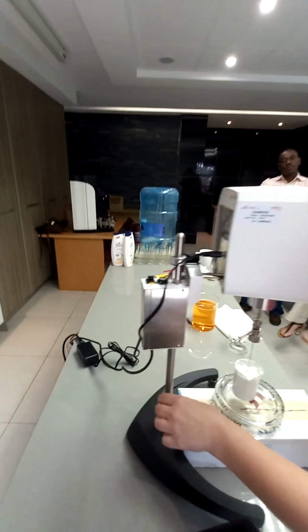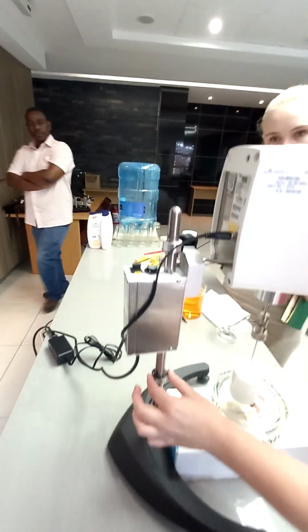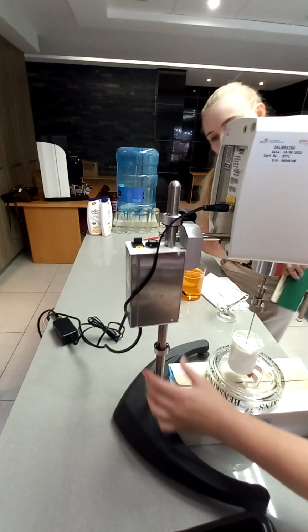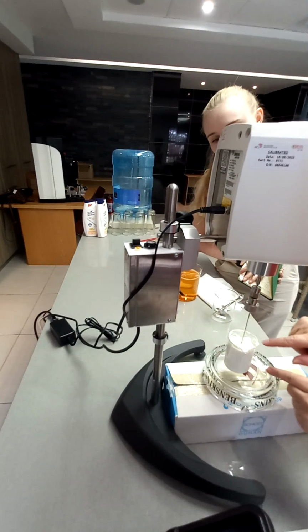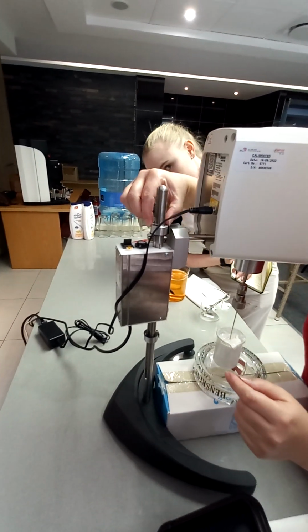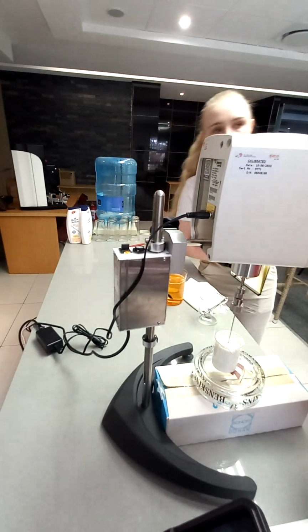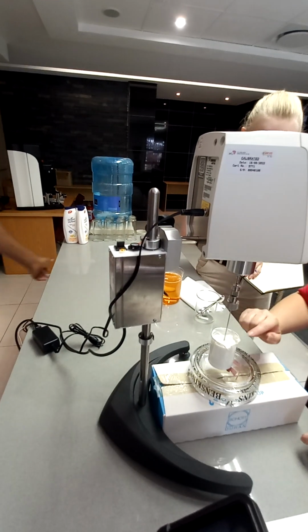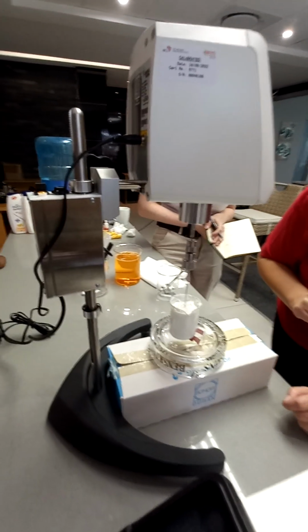Come look here. You've got these what we call stoppers. They can move up and down. So you've got one at the top. If this is your top level, you can put this one straight down. Remember this is going down, so you don't want to go down too much where you're going to hit the bottom.